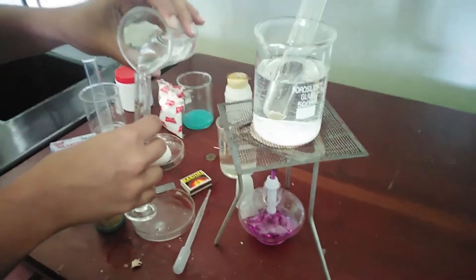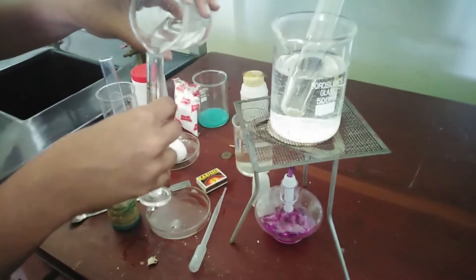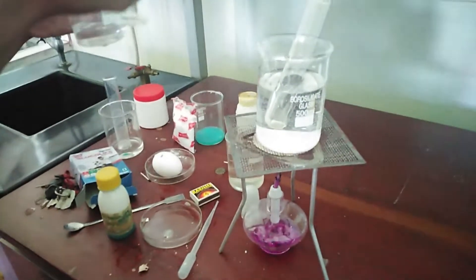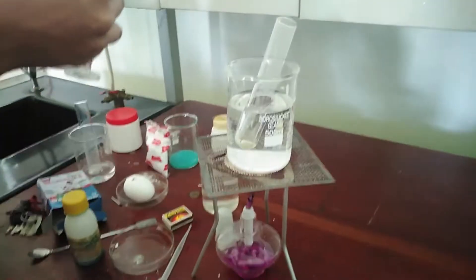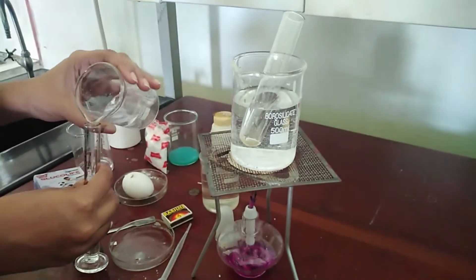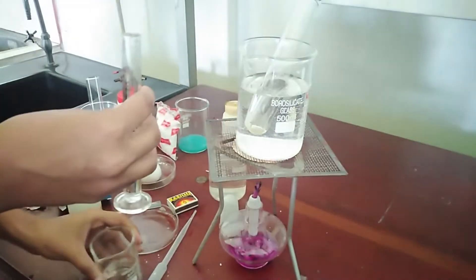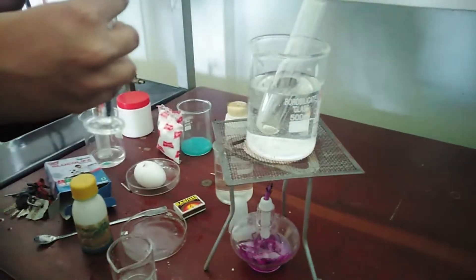Measure 3 ml of glucose into a test tube. Then measure another 3 ml of benedict solution into another test tube. Mix these solutions well and boil in the water bath. While boiling, you should observe the color change happening in the solution.